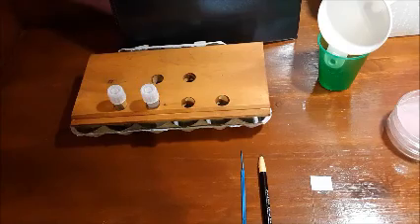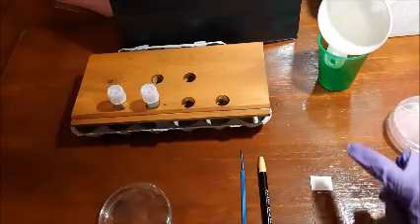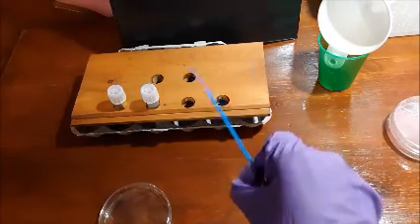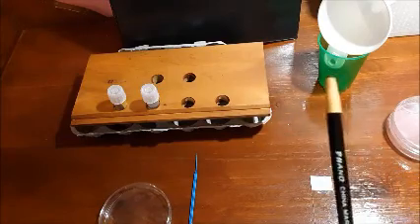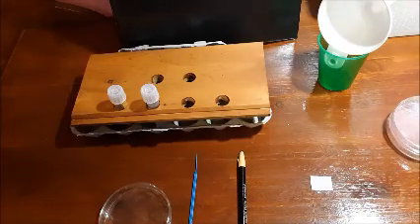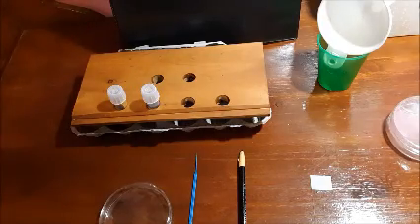We will also need a solid nutrient agar for streak plating. We will need a frosted slide for our bacterial smear. We will need our inoculating loop. We will also need a China marker so that we can use it to label our plate and also create a streak pattern, but that'll be later on. And we also need a Bacto incinerator to sterilize our loop and to actually sterilize the mouth of our test tubes, which you'll learn later on.